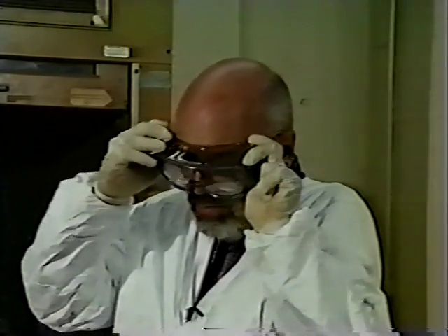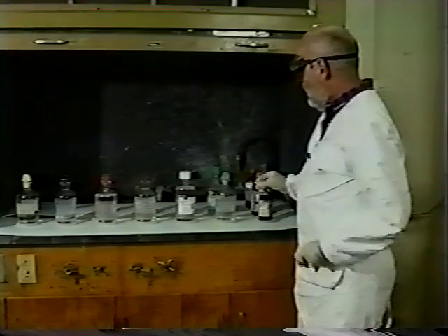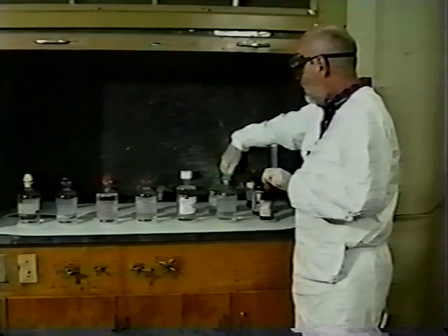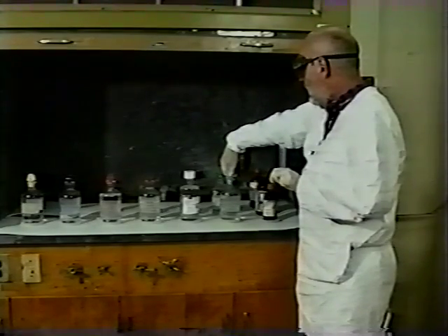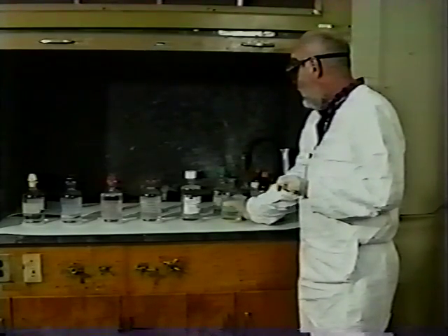Since I'm going to demonstrate how to pour properly from one of these bottles, I'm going to put my goggles on so that my eyes are properly protected while I am handling the chemicals. I'm going to pour some ammonium hydroxide into the graduated cylinder from the concentrated ammonium hydroxide bottle. Notice that the stoppers of the bottles, for the most part, are so-called flathead ones, which can be grasped between the index finger and the middle finger of one hand.